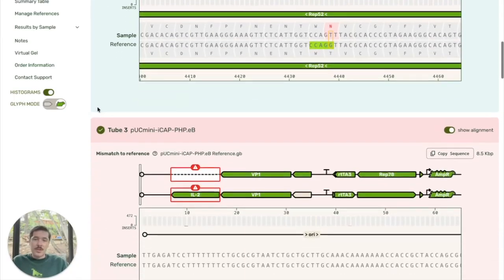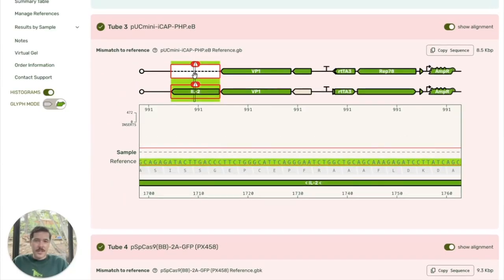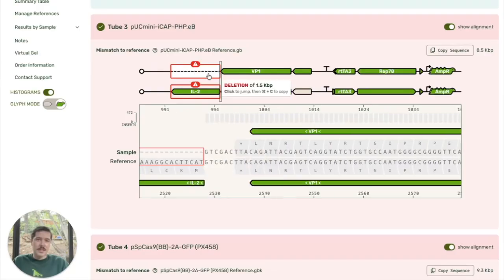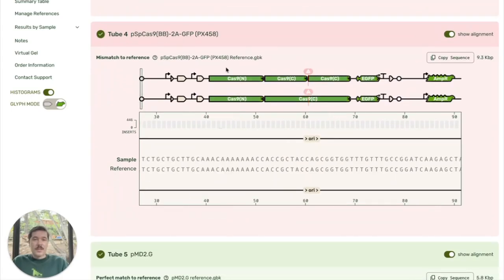Now if I scroll to tube number 3, we can see we've got a deletion. Again, if I hover over, it's going to show me we've got a 1.5 kb deletion. If I click on it, it will jump to it. And I can see that just before we've got perfect match, and just after we've got perfect match. But we are completely missing this gene, so that is a good thing to know. If I scroll to tube number 4, we've got a different issue. So again, if I click on it, it will take me right to it.